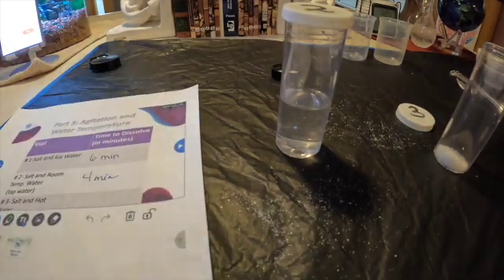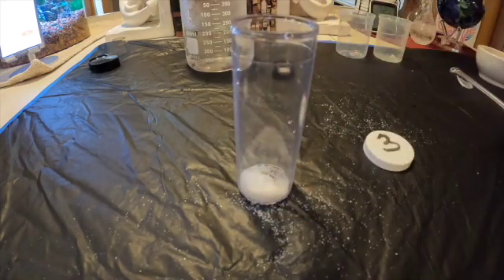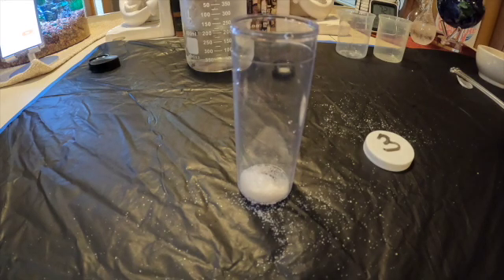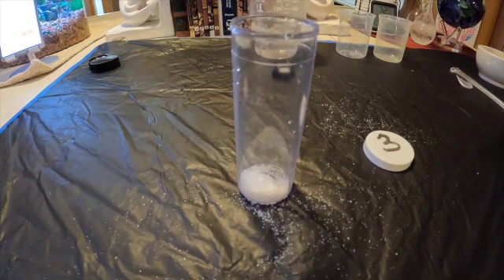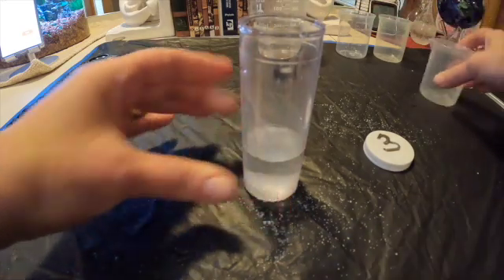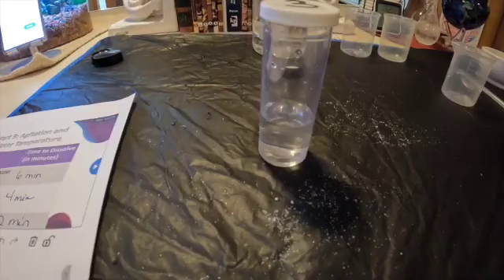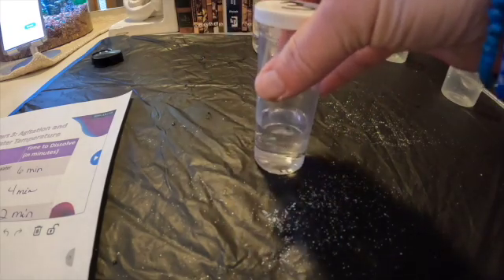The last one we're going to look at for part three is the coarse grain salt with hot water. I've pre-measured the amount of salt and I have hot water — we're going to add 20 milliliters of the hot water to the vial. It will be agitated for five seconds per minute, and we'll see how long it takes vial three to dissolve. For vial three, it was approximately two minutes for it to dissolve. You can see here it's fully dissolved — record your observations. It was two minutes, and I have recorded that in the chart.